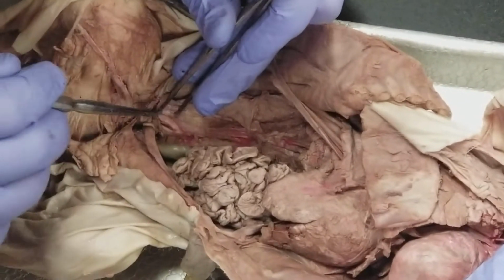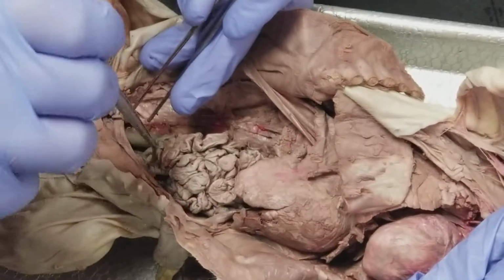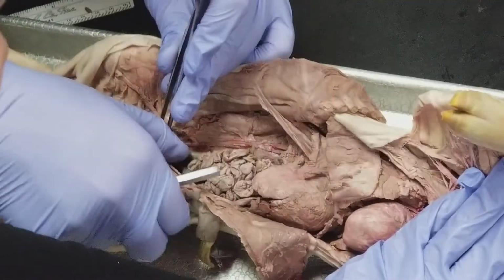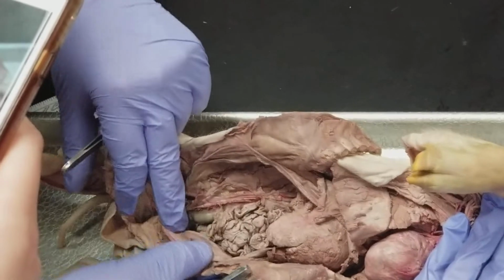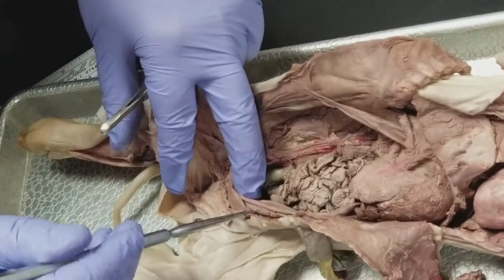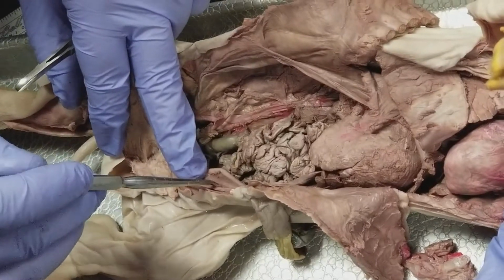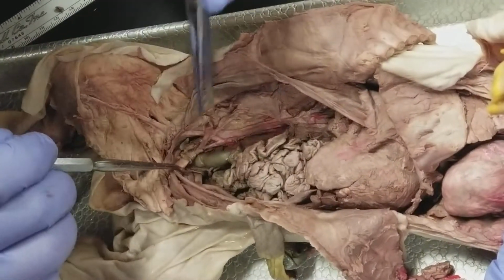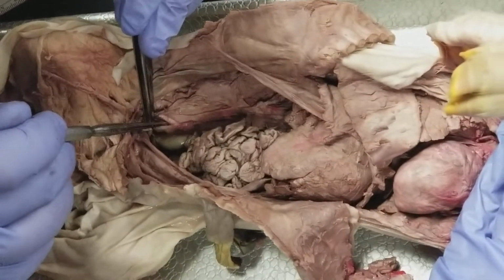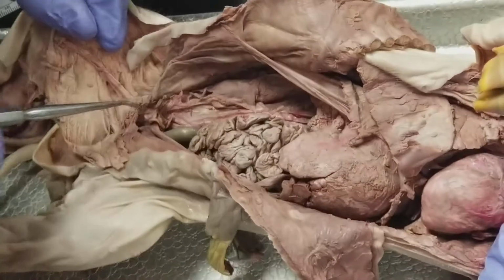So the aorta is going to also branch into left and right common iliac, and then because we have fetal pigs, we actually have terminal branches that are the umbilical arteries. So you can see here and here are the right and left umbilical arteries. In between is the bladder, which we're not going to worry about right now. And so those are actually coming off past where the iliacs branch, which wouldn't happen in an adult.